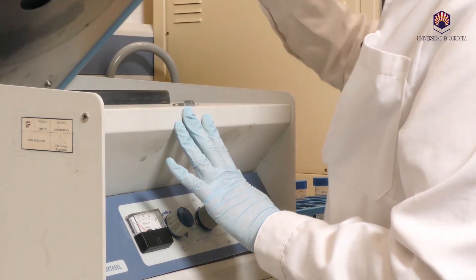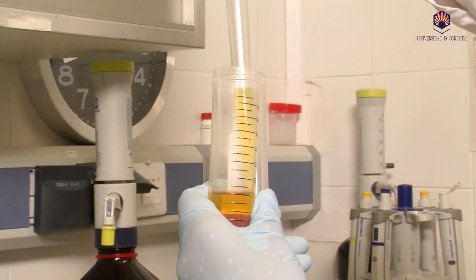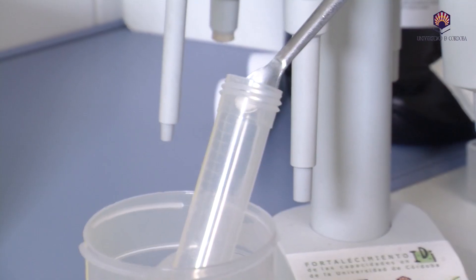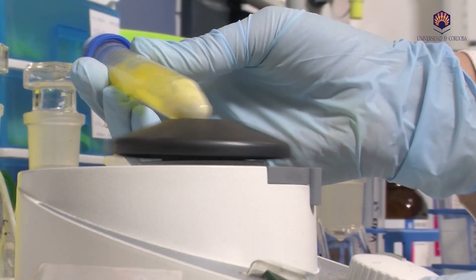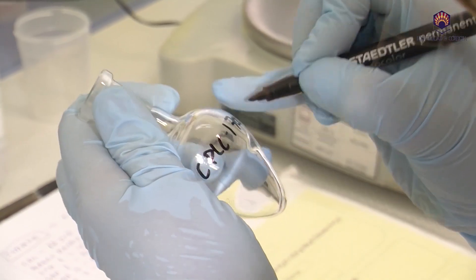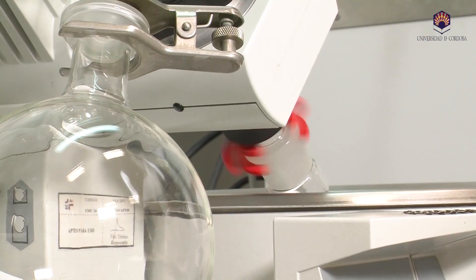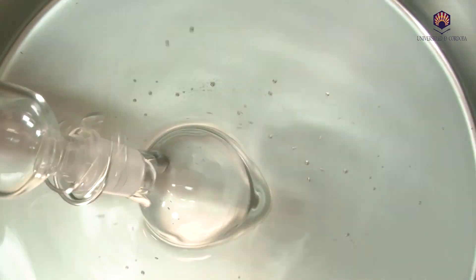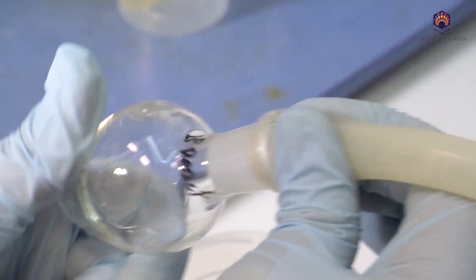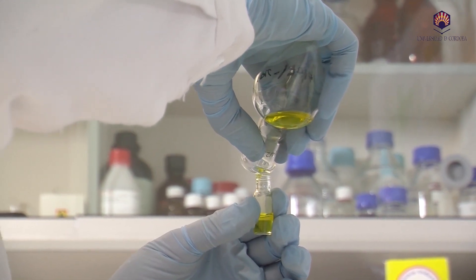After extraction and centrifugation, we go next to the cleanup step, taking 6 millilitres of the extract and adding salts such as PSA, that will eliminate the organic acids, fatty acids, sugars, and pigments that might have passed into the organic phase. Finally, for the injection of the sample in GC-MS, an aliquot of acetonitrile is evaporated and reconstituted in the same volume of the cyclohexane ethyl acetate mixture, since these solvents have a lower boiling point, which will improve the evaporation of the compounds in the injector of the GC.